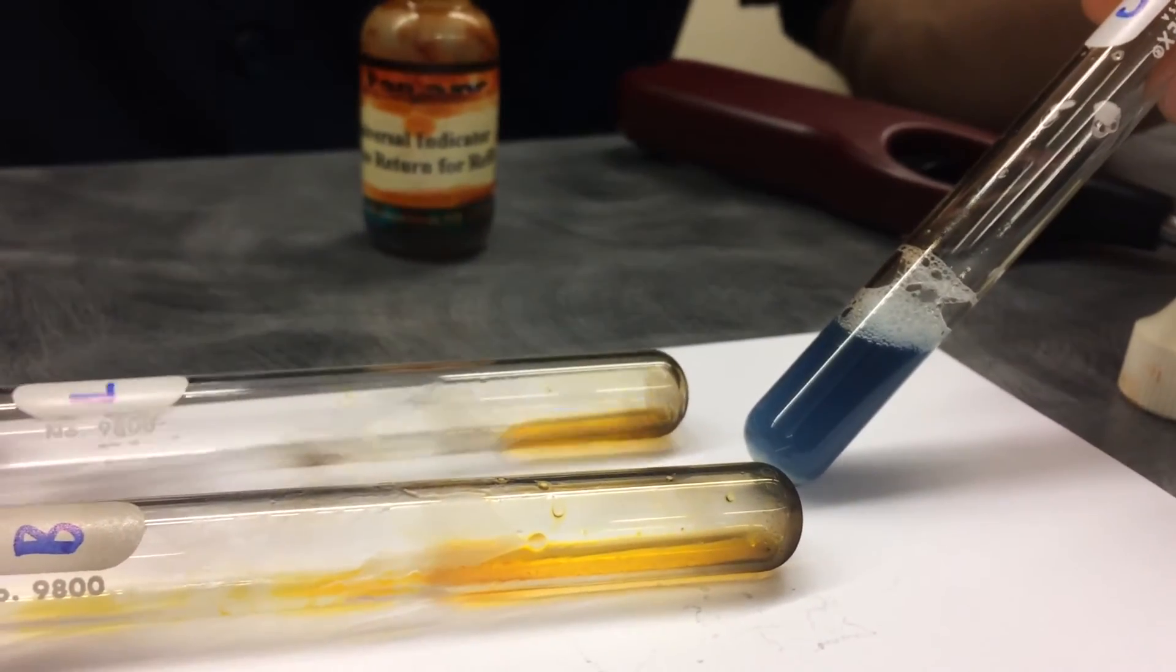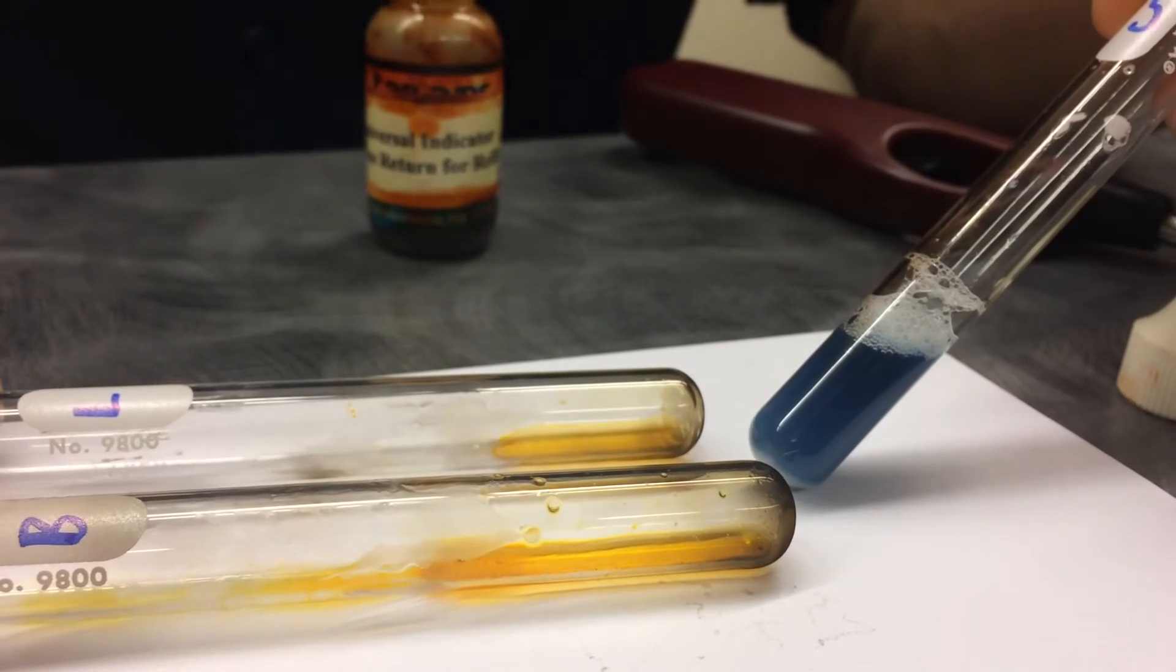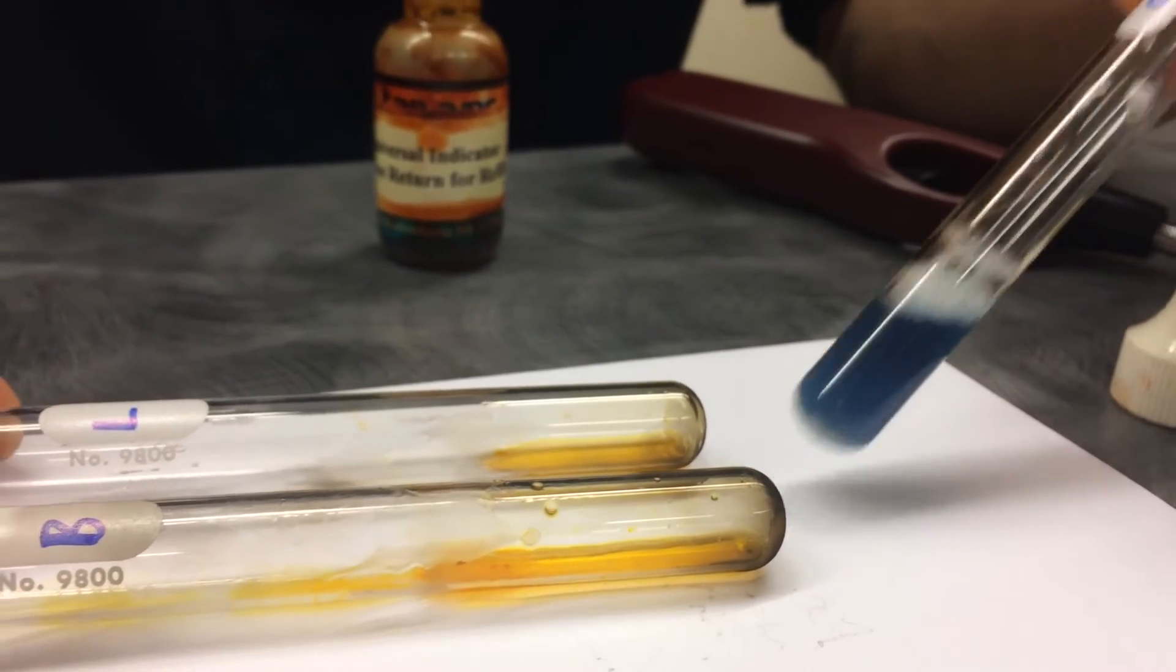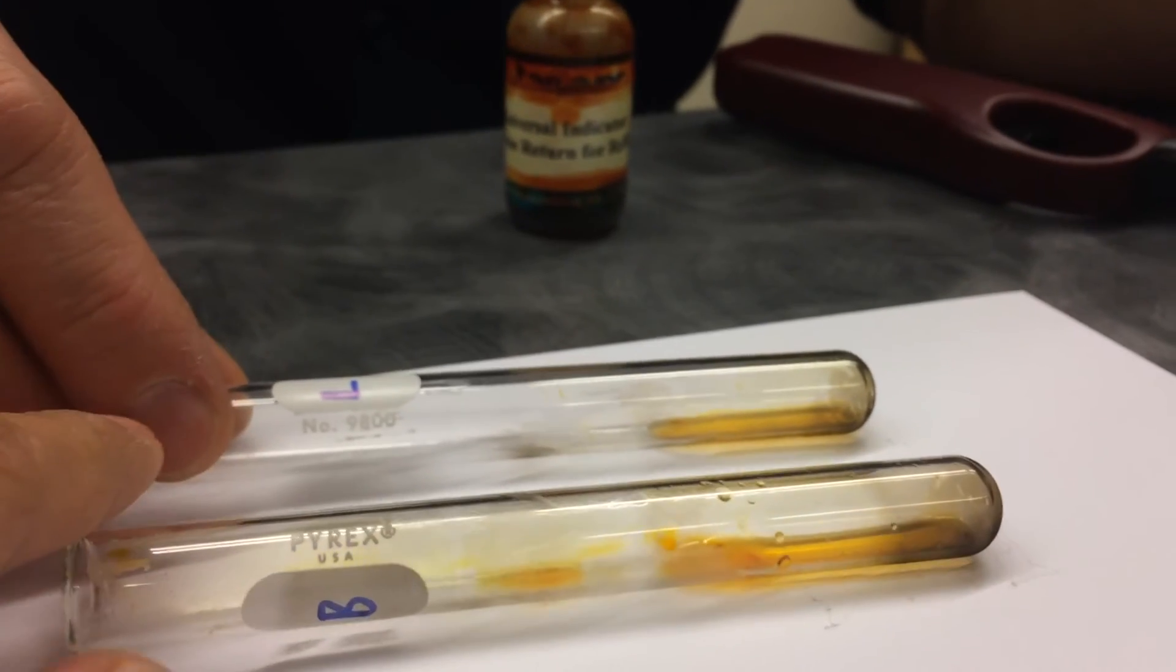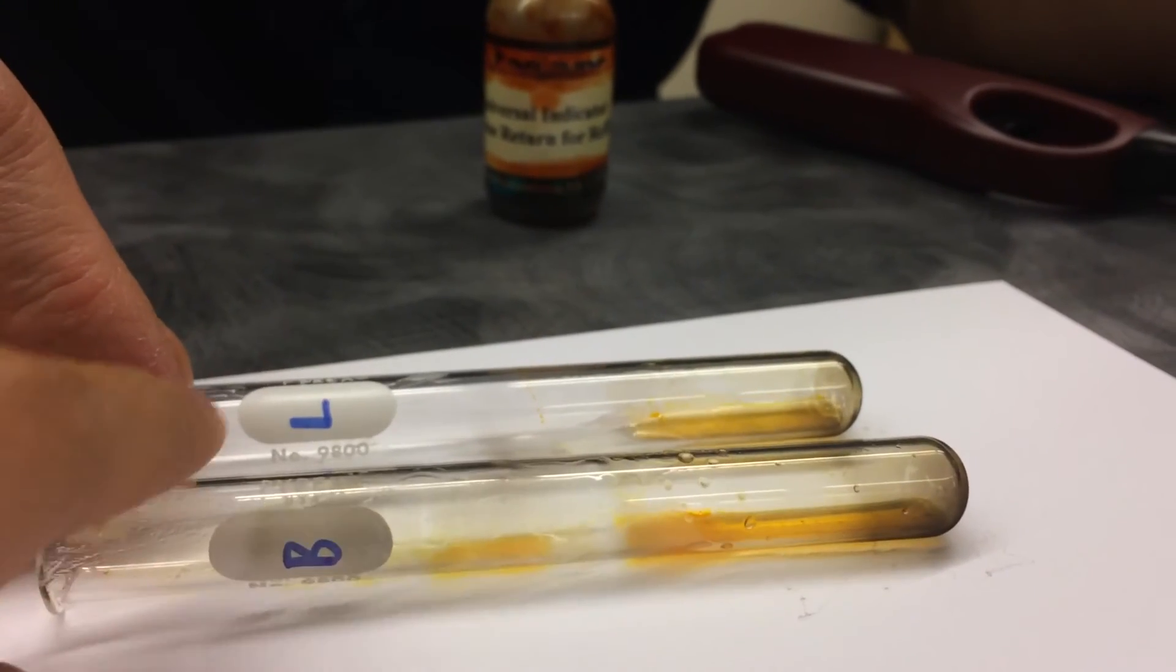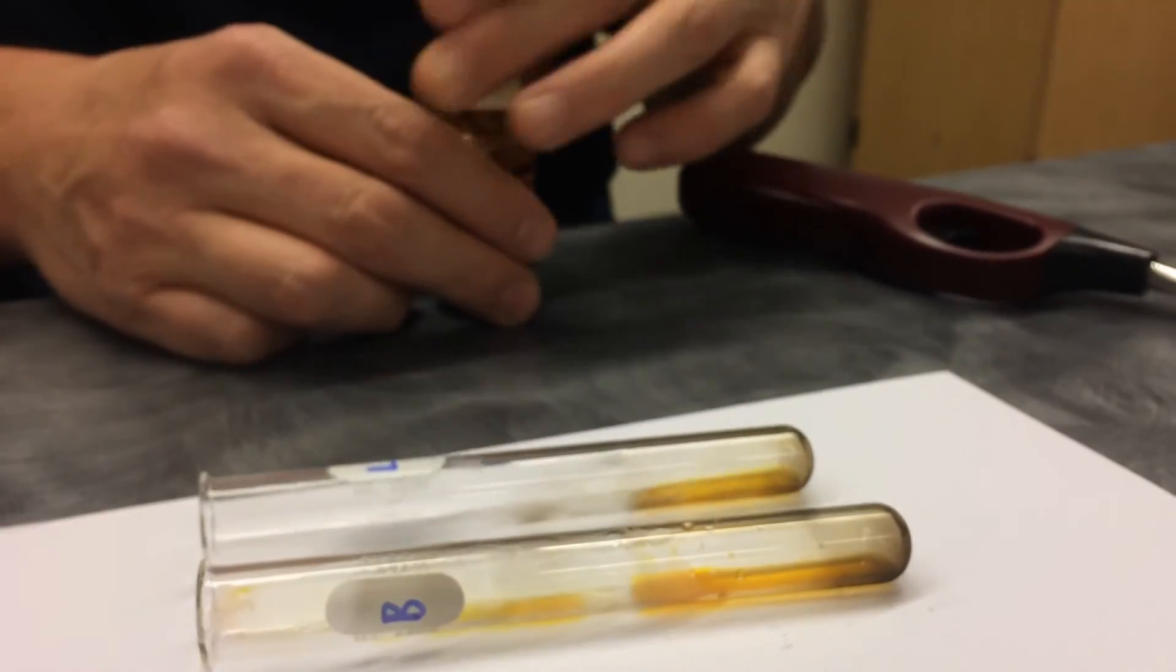Yeah. Mr. Evans, that's pretty different for the soap. The blob and the lard look the same. So, the B, remember the B is for blob, L is for lard. All right, guys.